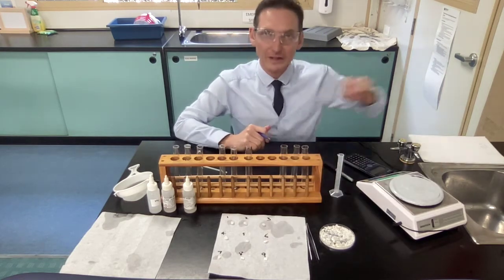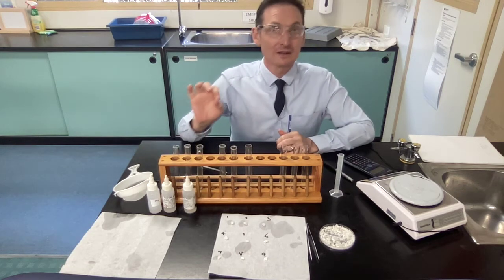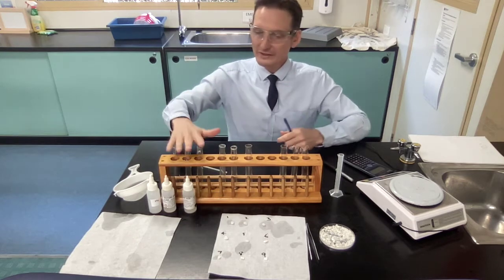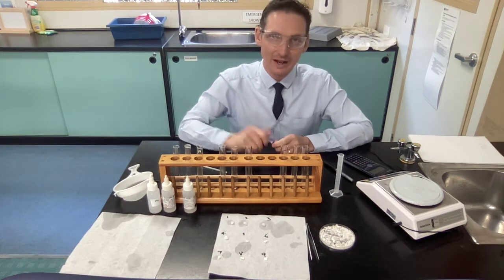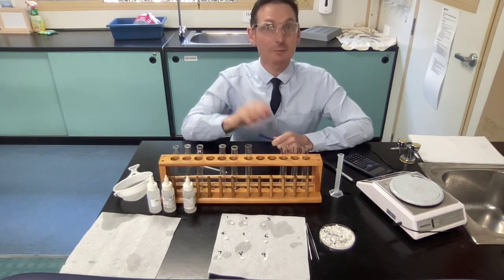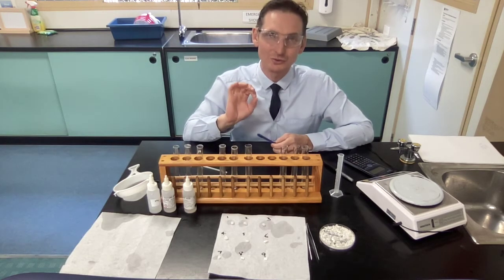All right, assume that I've reweighed all 9. I've written all that down. What you then can do is work out the difference, minusing the original number 1 mass from the second time that you did that mass, and find out the difference. That will show you which of these acids actually weathered these rocks more than the other. And you can put all that information with the changes and the differences that you are going to calculate, and maybe if you are able to, calculate the percentage difference, put that all in a table, and then figure out how you're going to graph it.